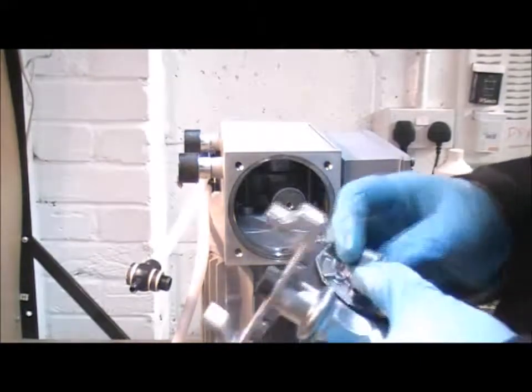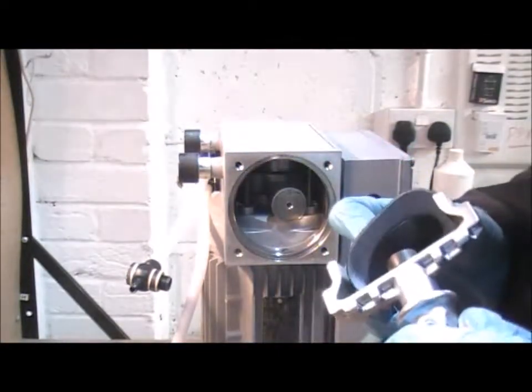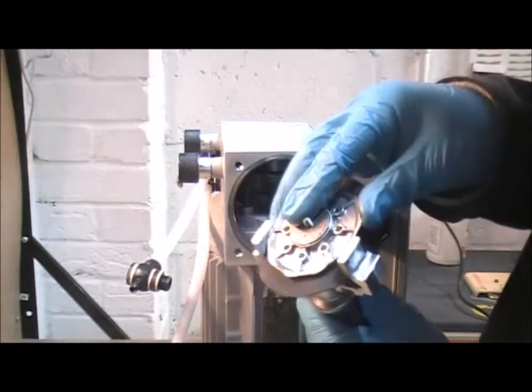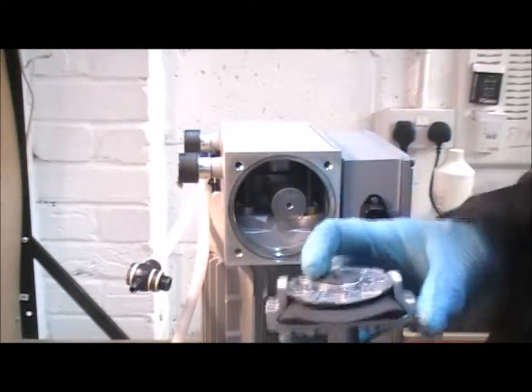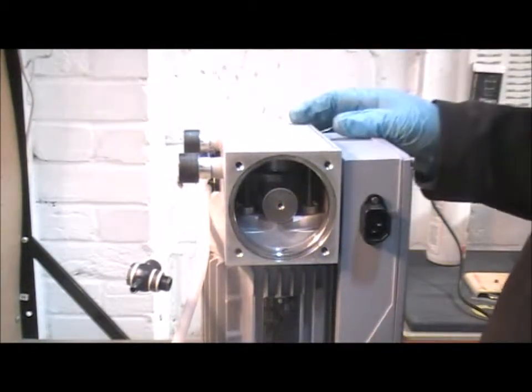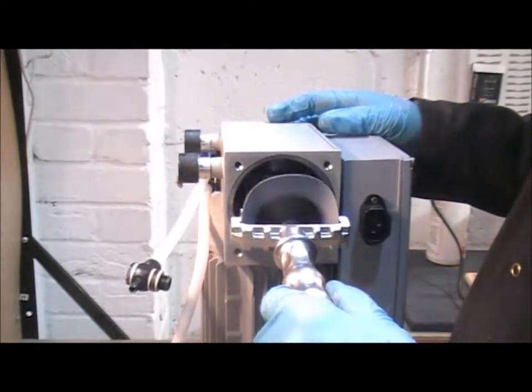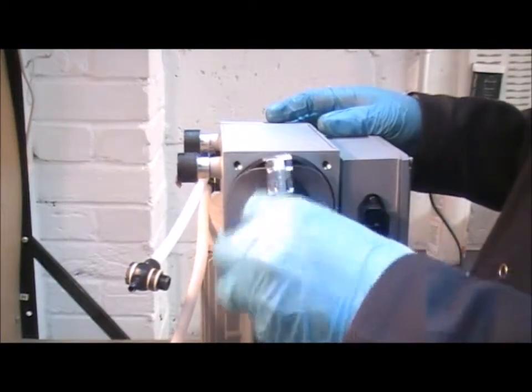And then folding up the sides just as the tool came out, you can locate that. And now at this point, this is why it's easier to have the pump in this orientation, because now it's just a case of lifting the tool with the whole assembly up and screwing it into place.